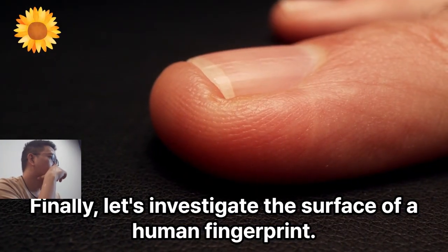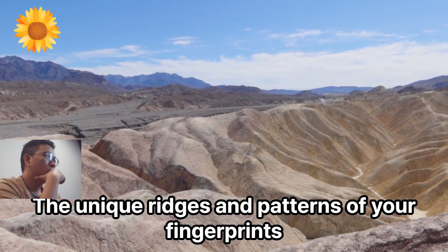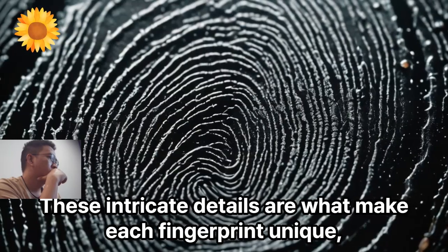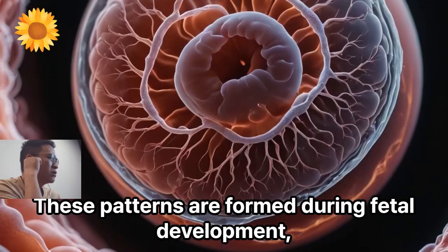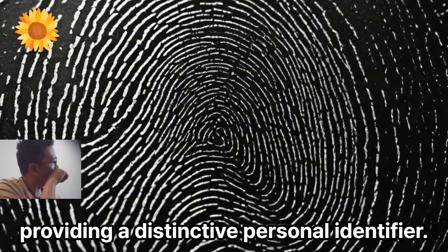Finally, let's investigate the surface of a human fingerprint. The unique ridges and patterns of your fingerprints are clearly visible under magnification. These intricate details are what make each fingerprint unique, used for identification. These patterns are formed during fetal development, providing a distinctive personal identifier.